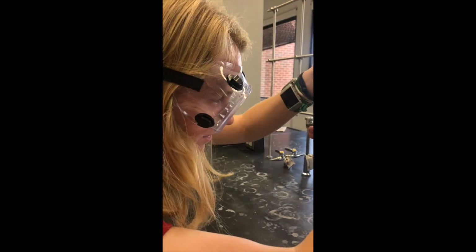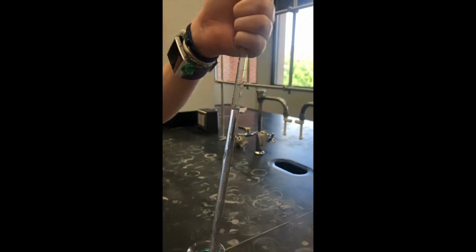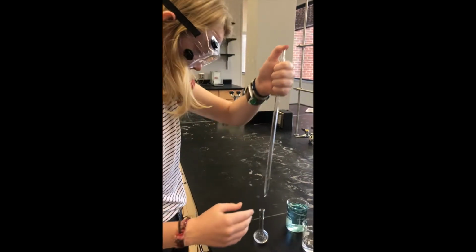The meniscus of the solution will form in the glassware. This is a concave surface that forms on a liquid as a result of the balance of non-covalent forces in a narrow container. To read the volume, hold the glassware at eye level and read at the bottom of the meniscus. Be sure to measure to 1 degree of uncertainty. In the 10 milliliter pipette, measure to the tenths. Don't forget to subtract the volume you read from 10 milliliters when using this pipette.